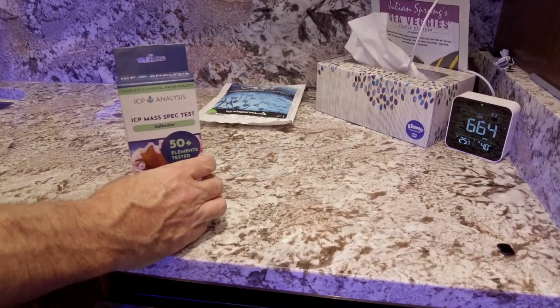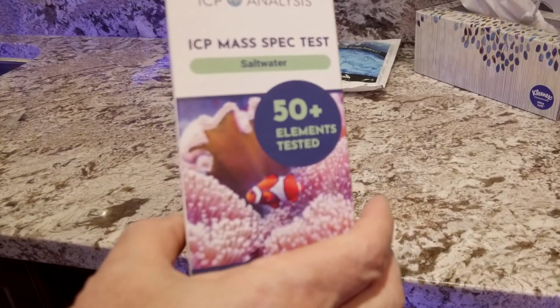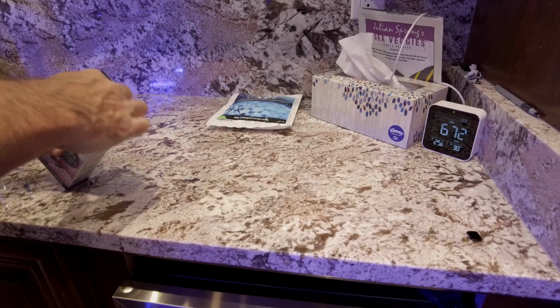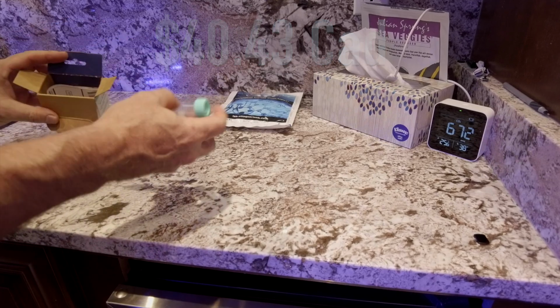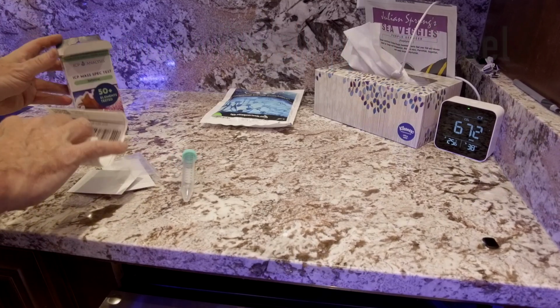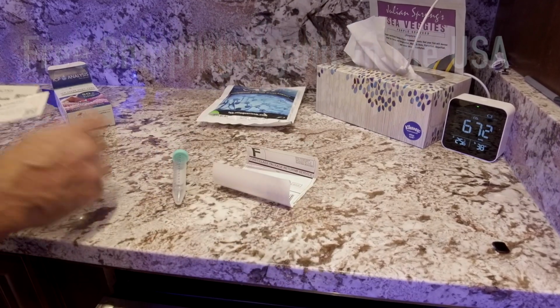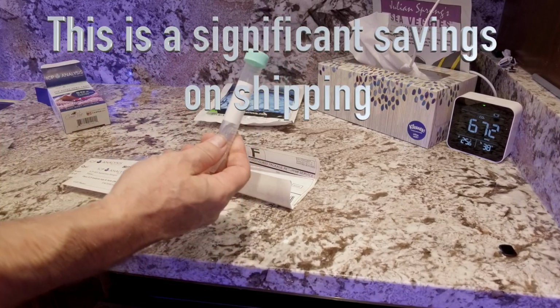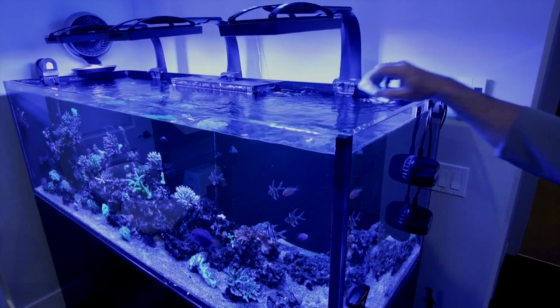For test number 3, last but not least, we have ICP Analysis. It's a pretty popular brand we see in the LFS all the time here in Canada. Let's get this water sample in. Again, this test has a single sample bottle, a shipping label, a quick start guide, and then the label for the sample, and the actual sample itself. So let's get this rinsed out and get a test in there. This is the ICP Analysis water sample we're going to do.